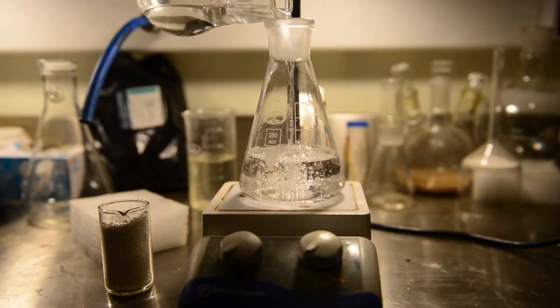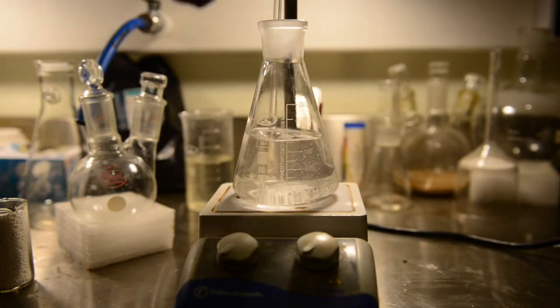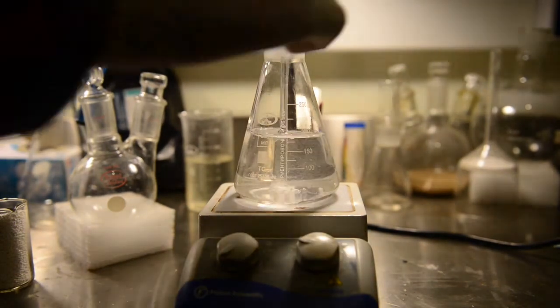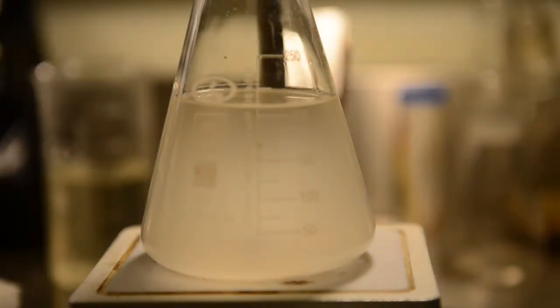To dry our allyl alcohol, I had placed the filtrate to 250 milliliters Erlenmeyer flask and added portion by portion dry calcium chloride. In total 120 grams of dry calcium chloride had been used.